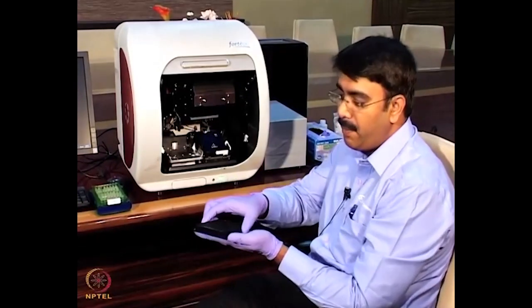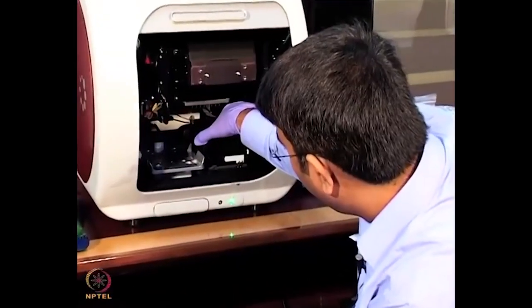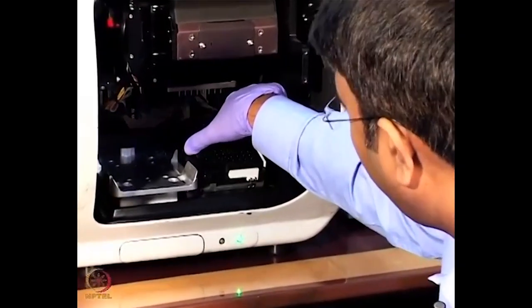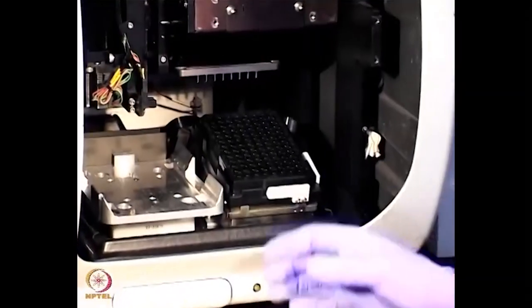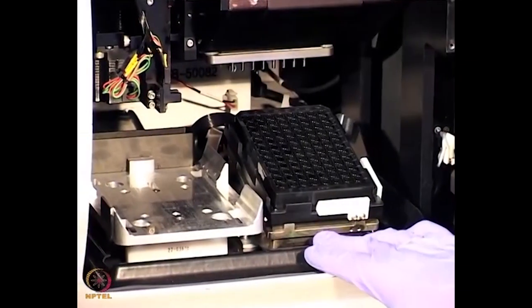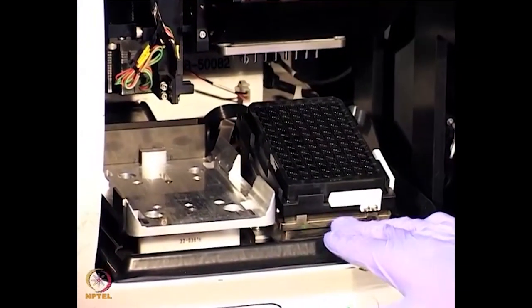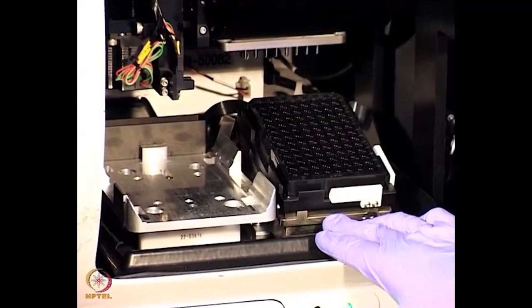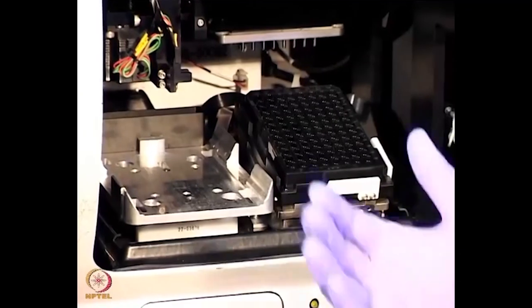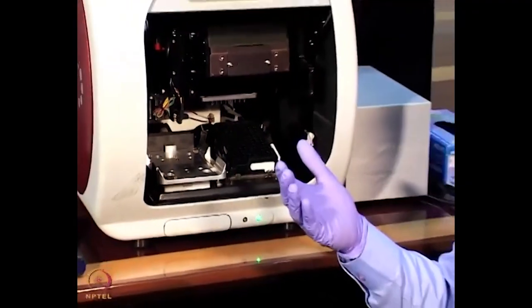This is the 96-well sample plate. I am going to place it in the sample compartment like this — there is a click sound when it fits firmly. The BLI technology works on the dip-and-read method, so we do not have any microfluidics devices. To assist binding, we have a shaker.